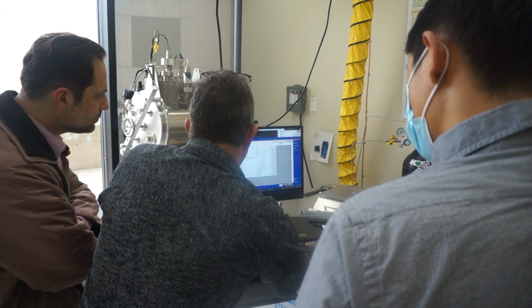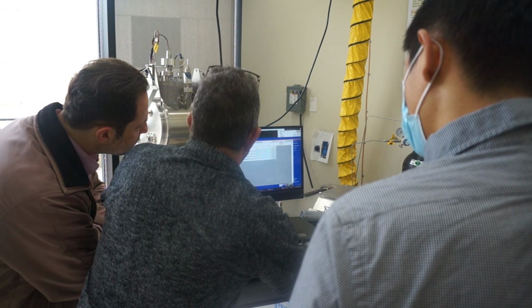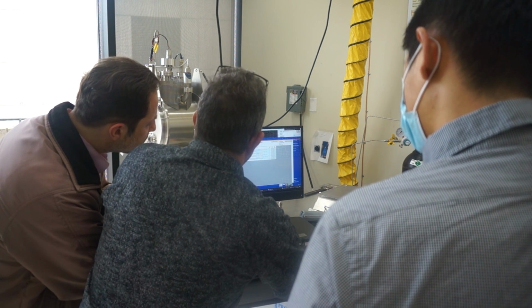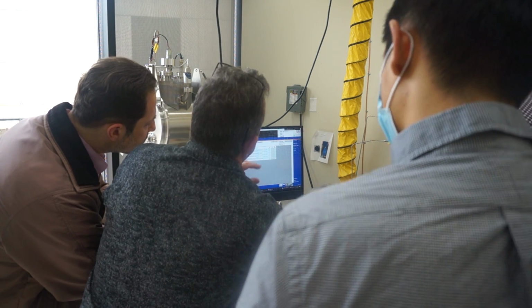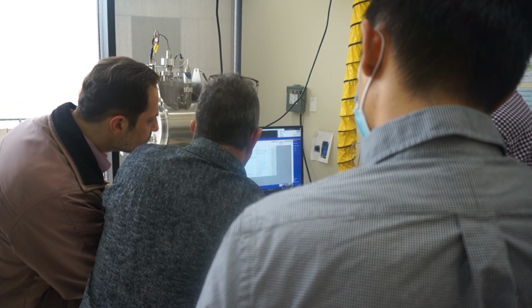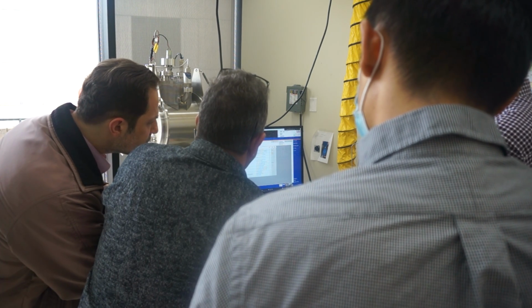Sets process active. And then it sets this recipe, which is the time part of it, the precision timing part of the ALD, what makes it go so fast. And then it runs the recipe and it just loops back.